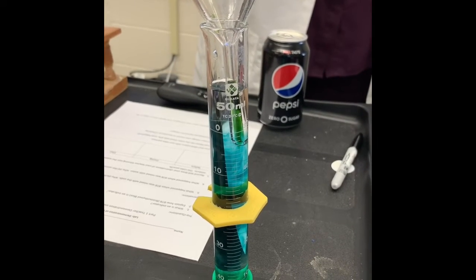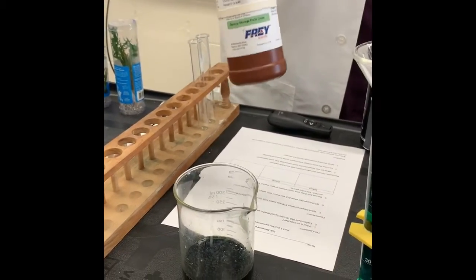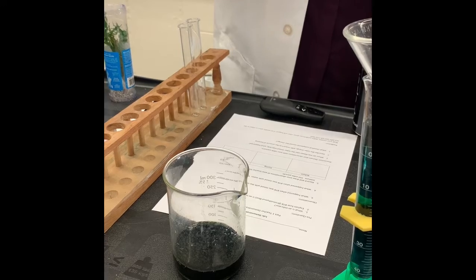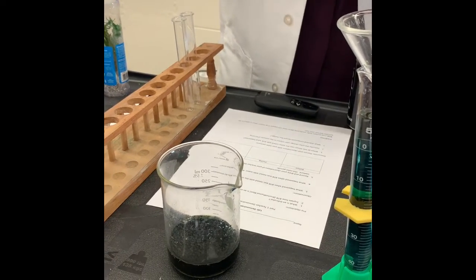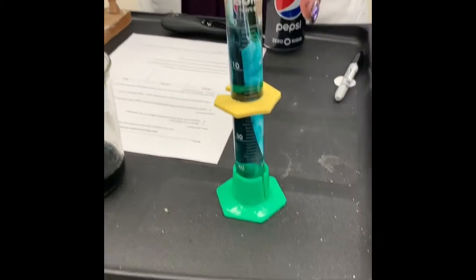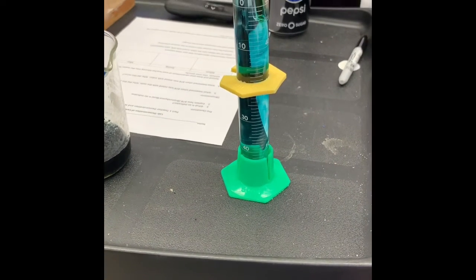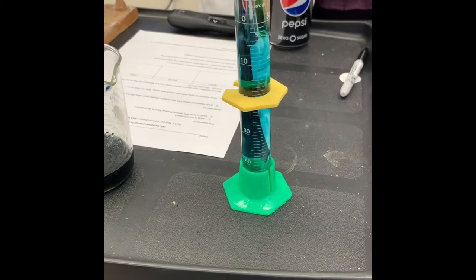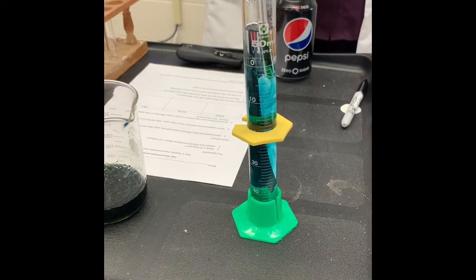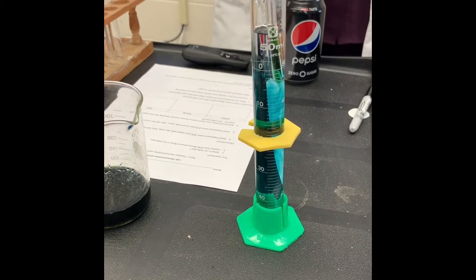Thank you. Yes, so we identified that BTB, this substance, is an acid indicator, meaning that it tests for acids. It will only change colors from the dark color to this light color in the presence of an acid. And is water an acid? Is it higher or lower? Is it a base? What is water? So we know that an acid is less than 7. However, this water is 7, so it's not an acid. So it's not going to change colors.